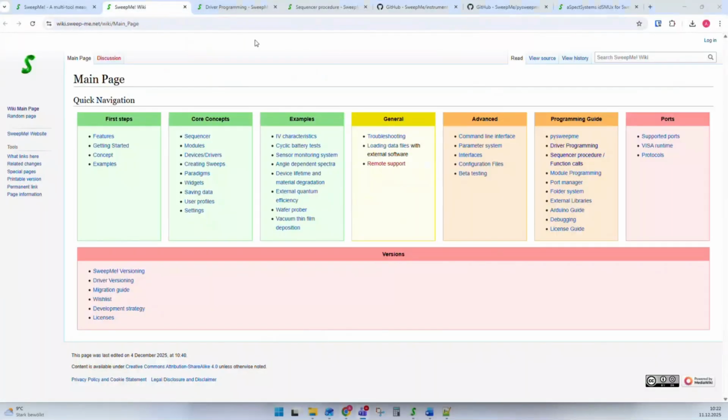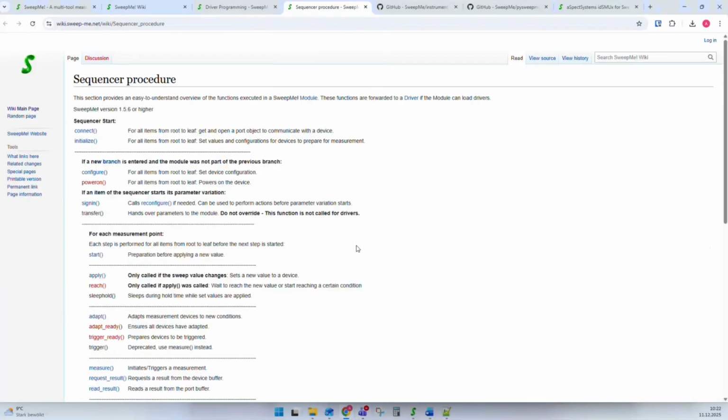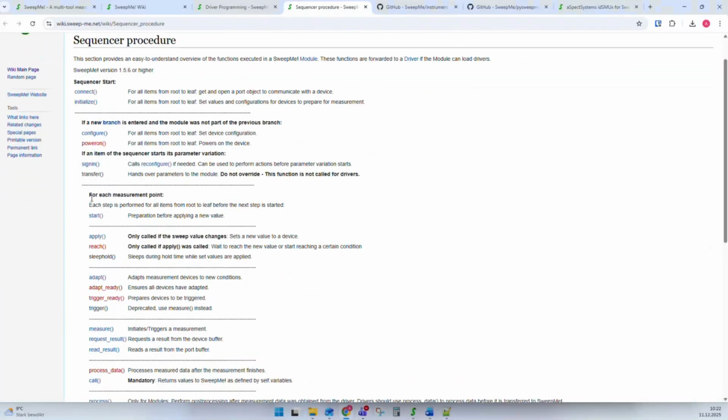In our wiki, you have this sequencer procedure function calls. I already opened them. And here you can see a scheme of these functions, what they mean and when they are called. For example, some functions are only called once at the beginning when you press the run button. This means you have maybe 10, 15 drivers or modules in your sequencer. You speak to many different instruments, and at the beginning of a measurement, they are first all connected and then initialized. And this phase can then be used, for example, to make sure the instrument is there and it is responsive and connected.